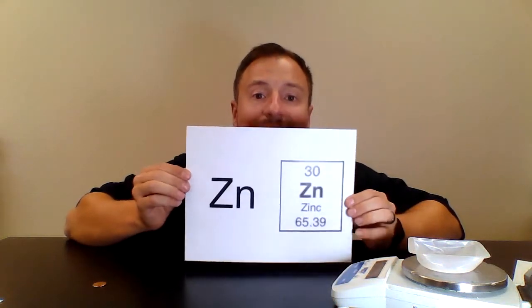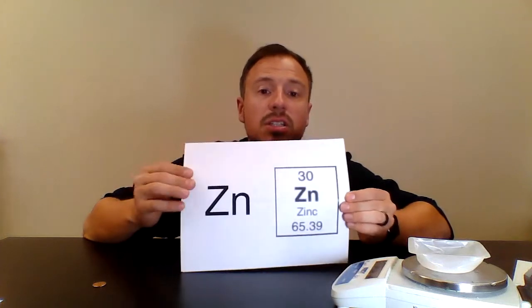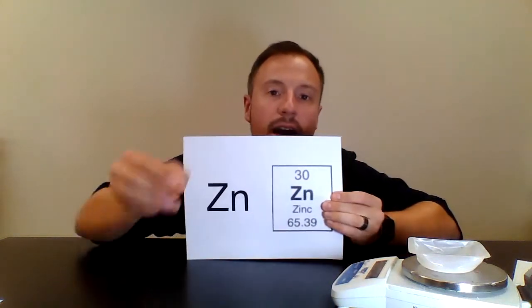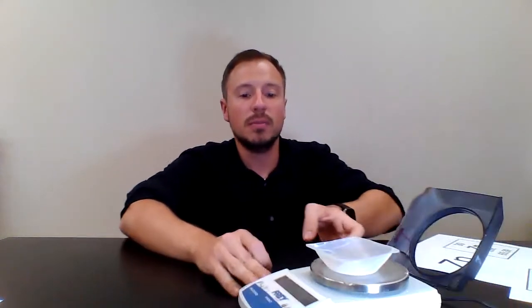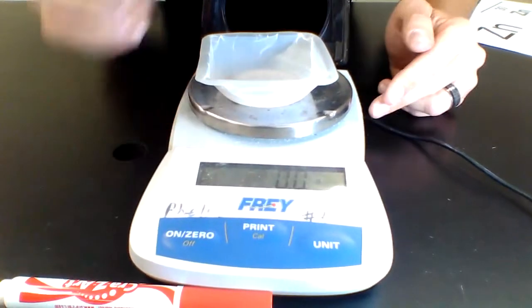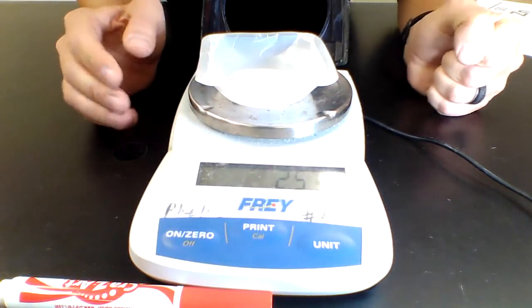Right? So I have this one that was made in 2012. Now, the thing about pennies that were made after 1982, they're mostly zinc, right? They are copper coated, but over 97% of them are going to be zinc. So you can see it's a little heavier element. So I'm going to find out how many atoms are in this post-1982 penny. So first thing I need to do is find the mass of the penny. So I'm going to do the same thing. I'm going to zero the scale again just to be sure that it's properly zeroed out. I'm going to place the penny on the scale, and you can see that it is 2.5 grams. So now I know I have 2.5 grams of zinc.